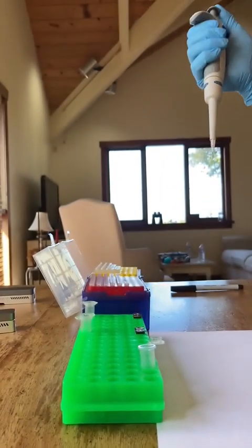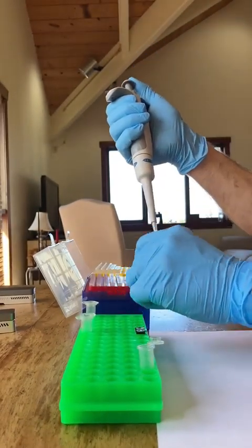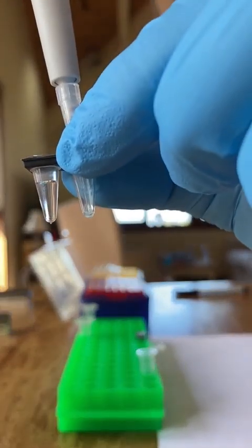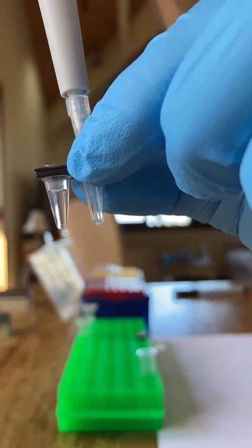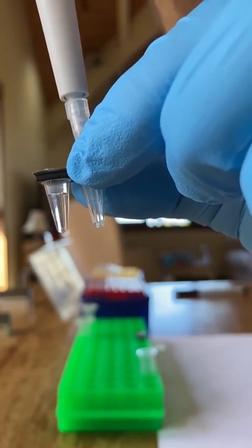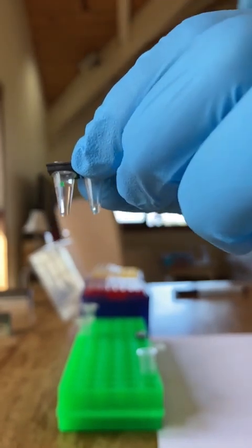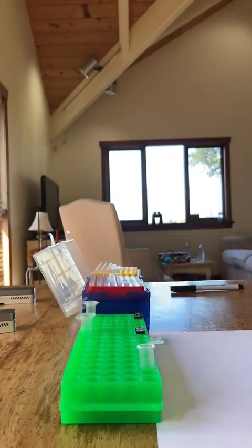Here's the other sample, which you can actually see. Take out that 10 point whatever. Take out all of it. Put it into tube 2. And there you go, you can see that. Pipette up and down 4 or 5 times smoothly. Try and be gentle with that until that's done. That's going to incubate for 5 minutes.